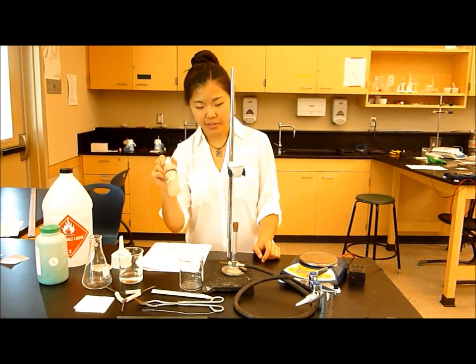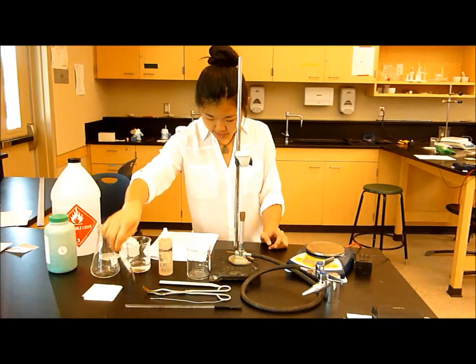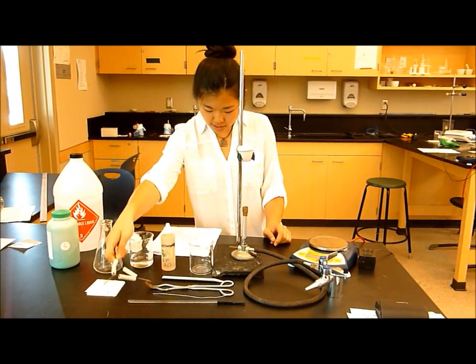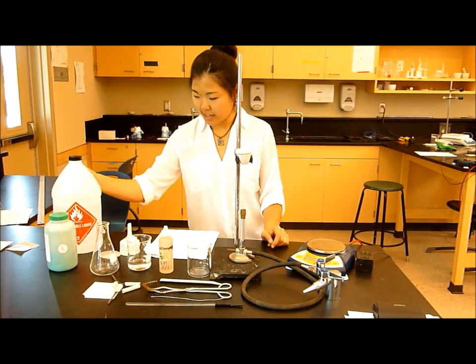a spatula, 6 molar hydrochloric acid, a ring stand and clay triangle, and 95% ethanol solution.